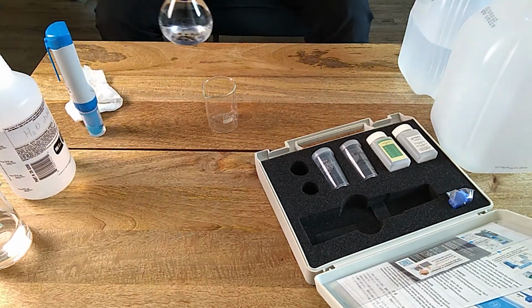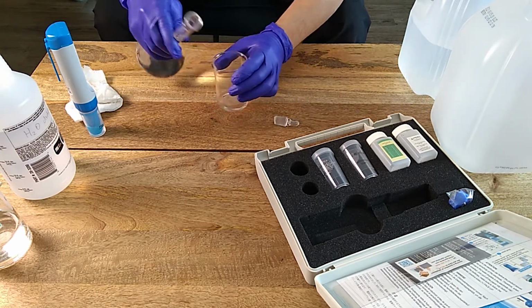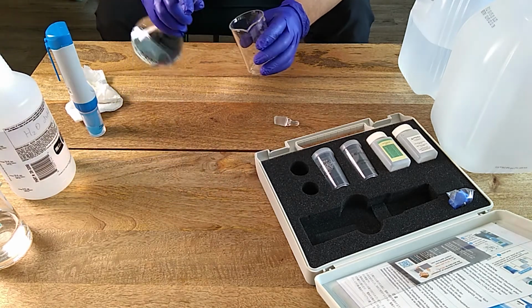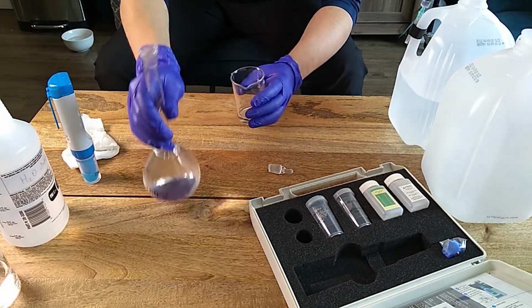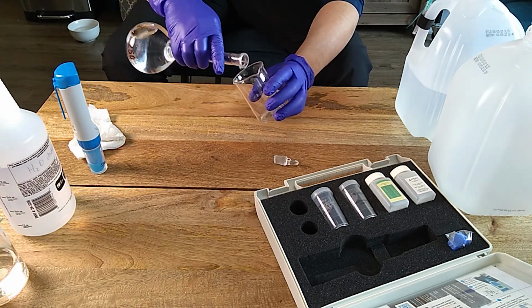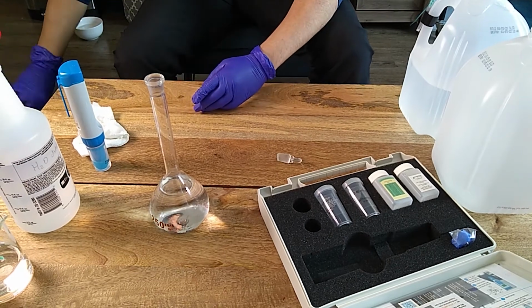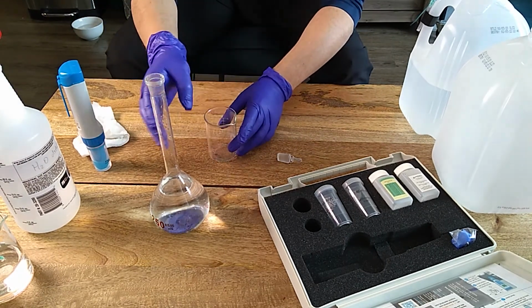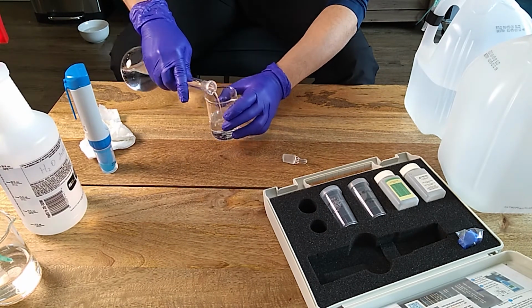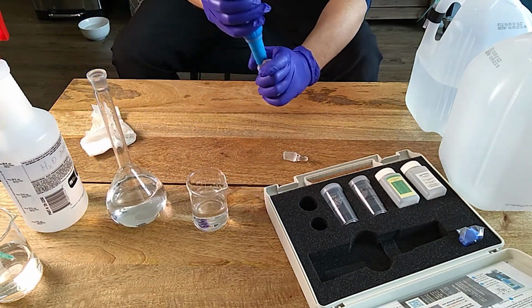And now the first thing that I need to do is to purge the glass, always purge. So I'm purging with the diluted solution to ensure that I wash any crap that's inside the glass with the diluted solution. Now I fill it to a comfortable point so that I can make the measurement accurately. Then I am going to take this out.